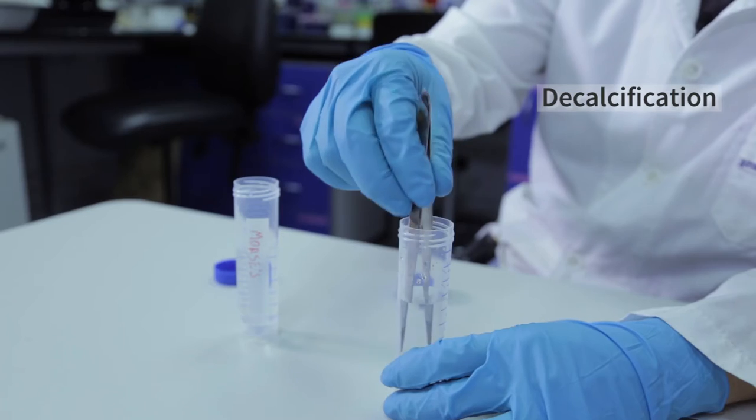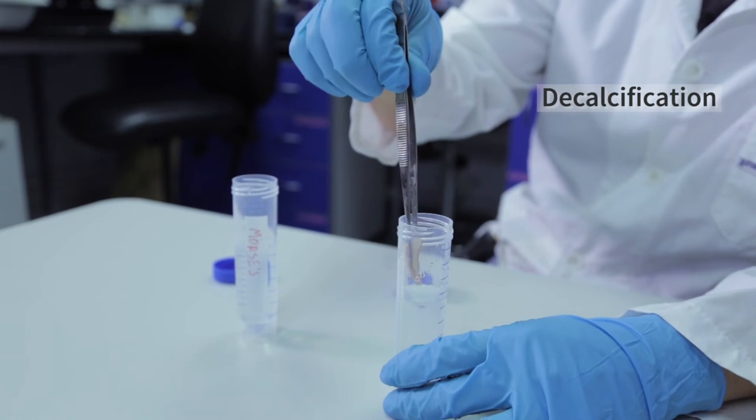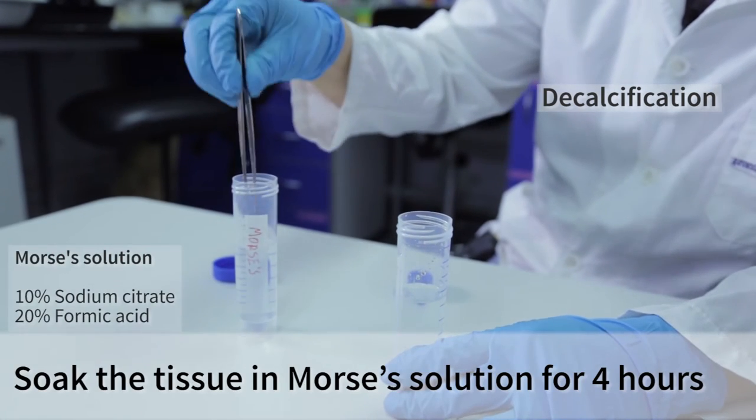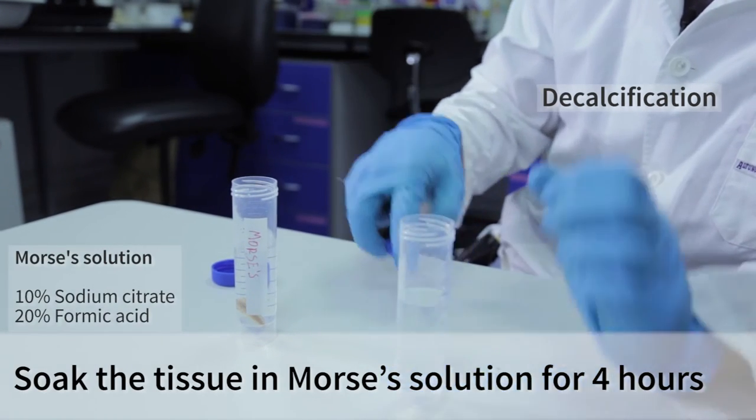Depending on the kind of tissue you are using, a decalcification step may be required for a good embedding procedure. Also, to avoid the loss of the tissue during the sectioning. For this, I will use Morse's solution for 4 hours.